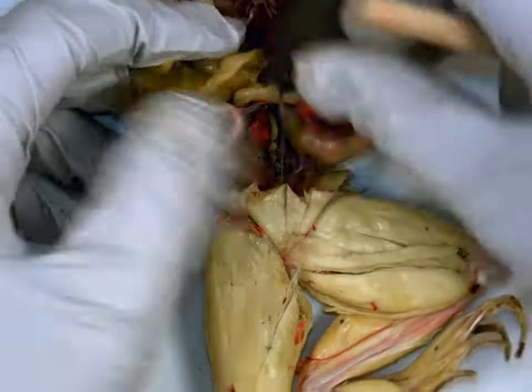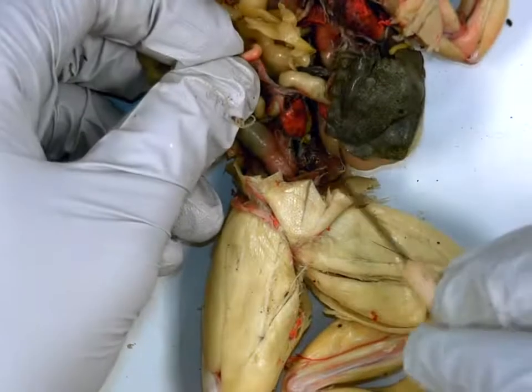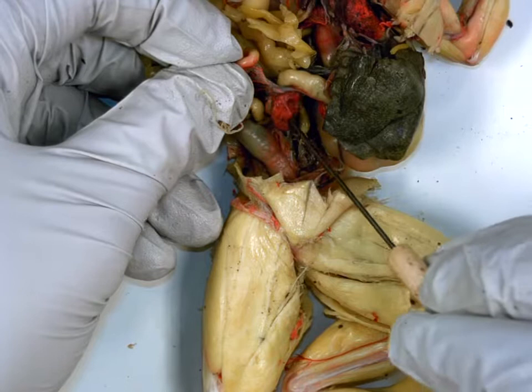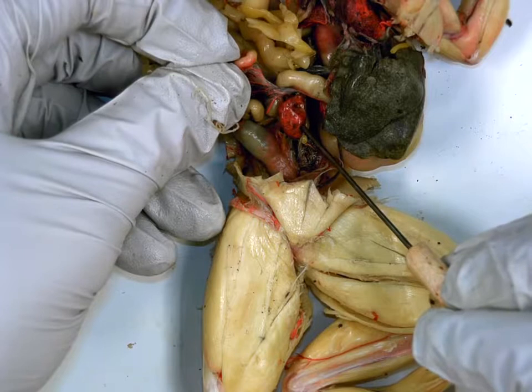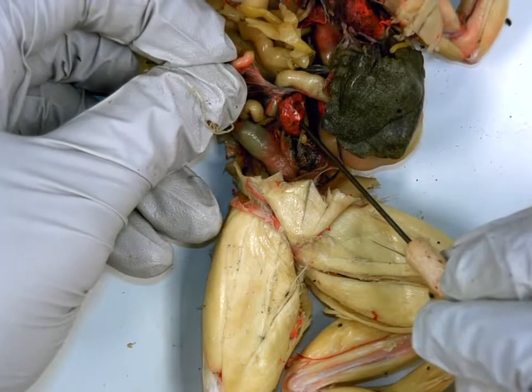Then if you pick up your intestine kind of by your large intestine, you should see one dark structure. It may be pink because of the blood flow, or it's either that or dark brown. Spleen. 3 functions. Remove, store, and create red blood cells.